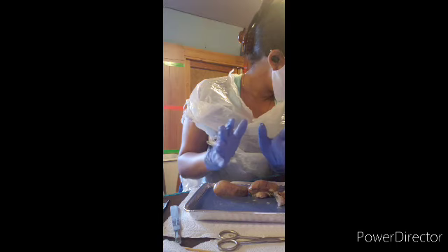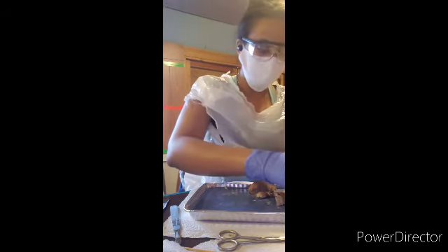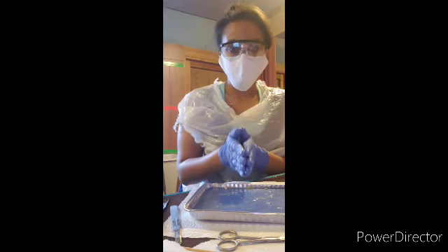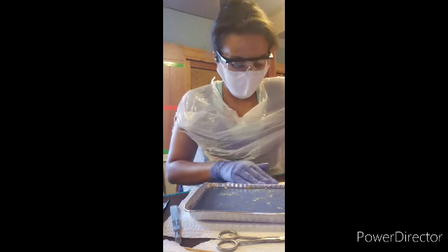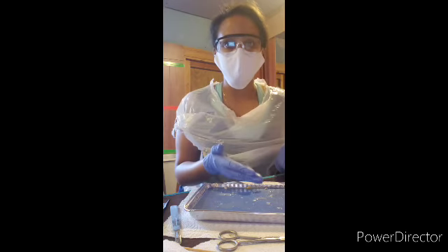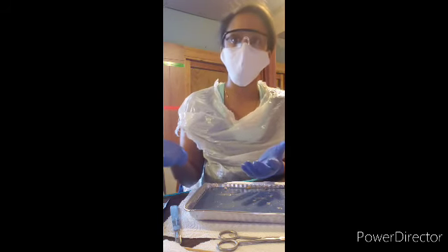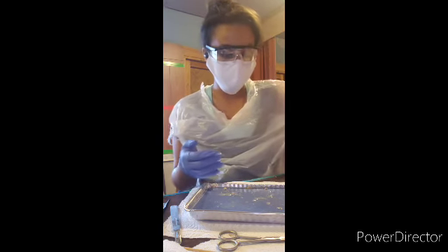Now, I believe that is all for today. Hopefully I did this correctly. I am so sorry, brain. Hope you guys have a wonderful, safe day, and I do apologize again to my professor if I did not do this correctly, or the brain came like that, because as you saw in the video, I opened it, there was no spinal cord, as I saw in the recording of what you gave us. There is no spinal cord from my perspective.